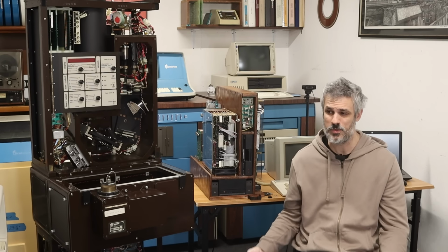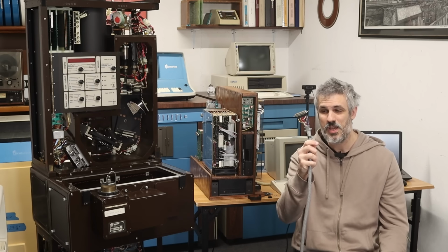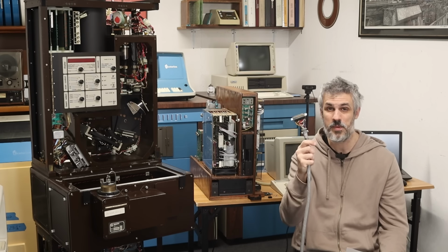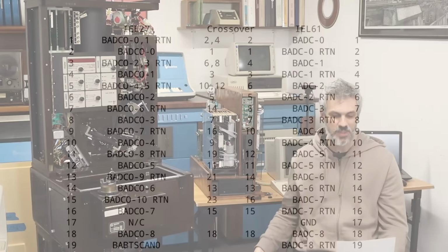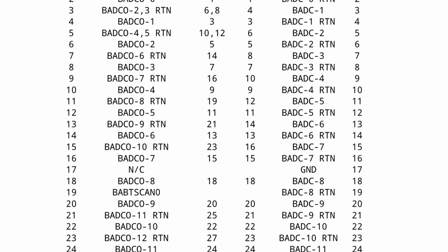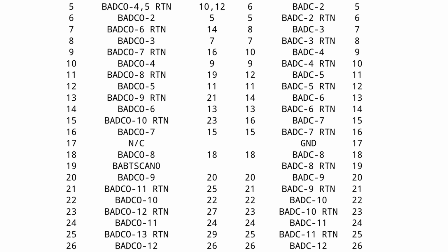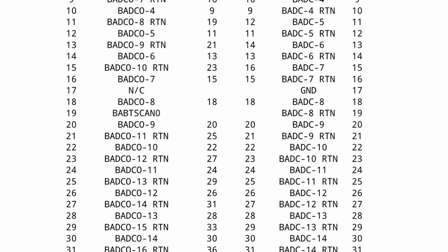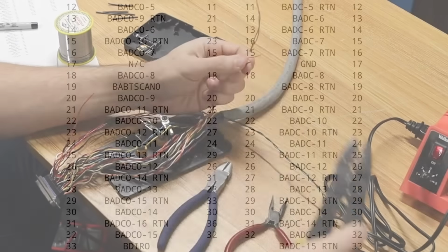So what I could do is take one of these apart and maybe slice the wires and create a custom 50-pin crossover cable that connects the IEL-61 to the PDP-11 here, which is expecting an IEL-27. Most of the signals all look the same, and I think I can create a list that tells me what goes where. It's tedious, but I wanted to give it a shot.